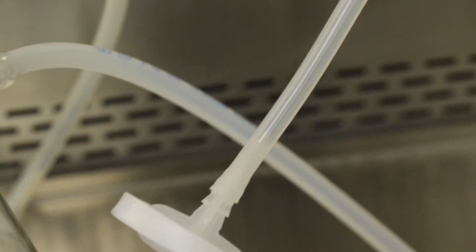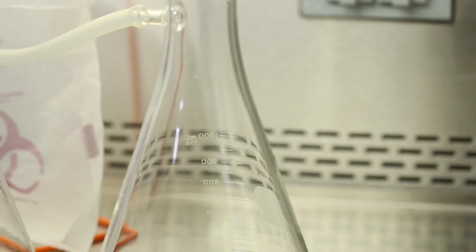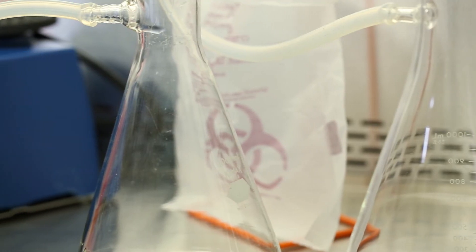Be sure to protect the vacuum line. This must include using a HEPA filter and capping unused lines.